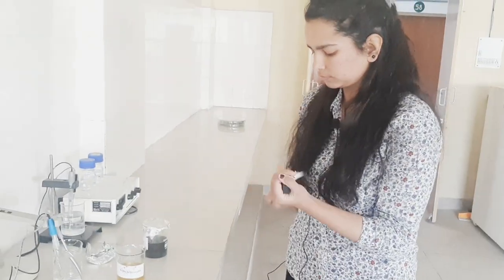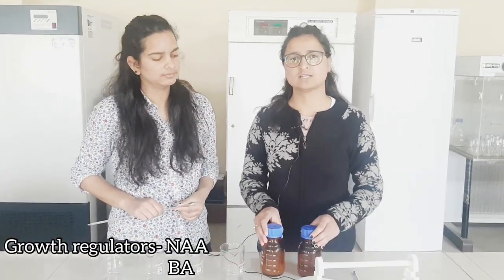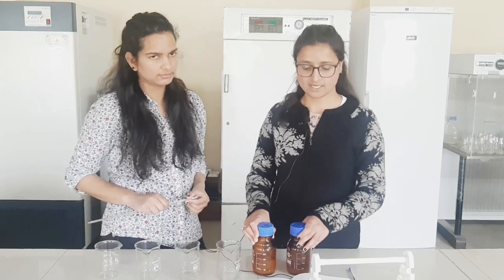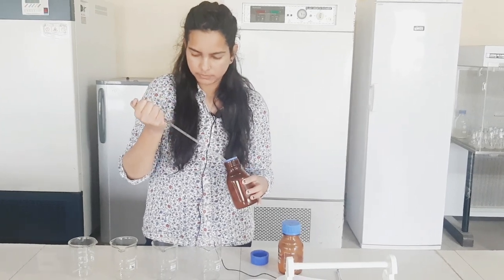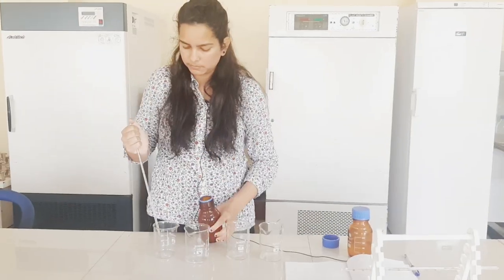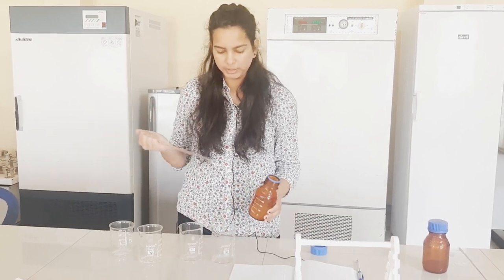Now we are taking 4 treatments: T1, T2, T3 and T4. We will take two growth regulators — NAA and BA. NAA is constant at 3 for all four treatments, and BA varies at 2.5, 3, 3.5 and 4. We have added NAA, now we will add BA. We have NAA constant across four treatments, and now we will take BA at 2.5, 3, 3.5 and 4.